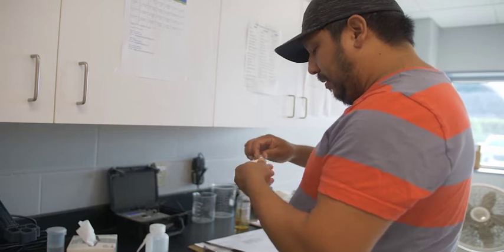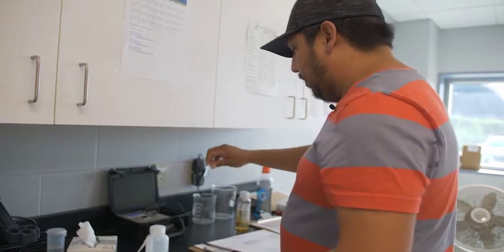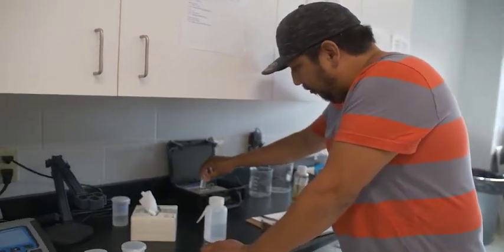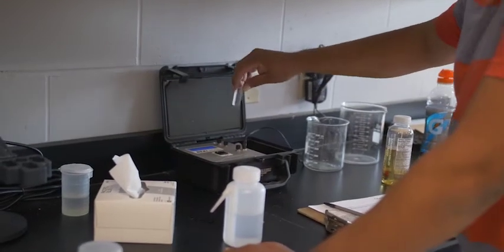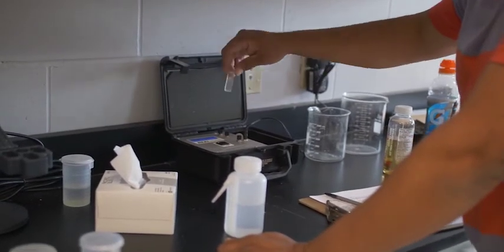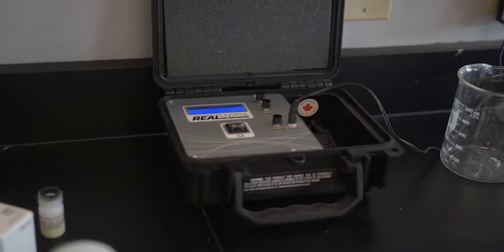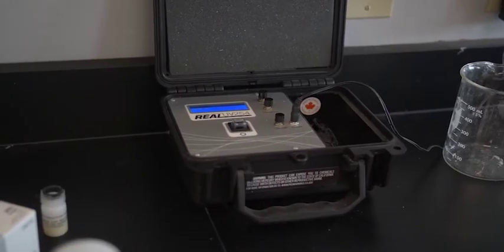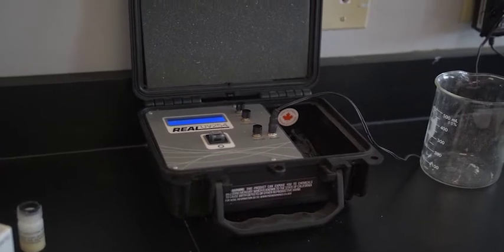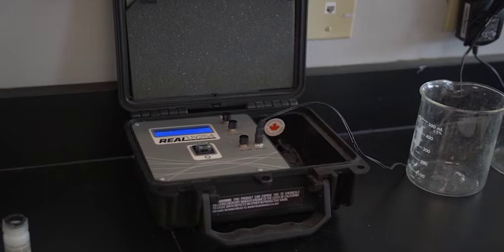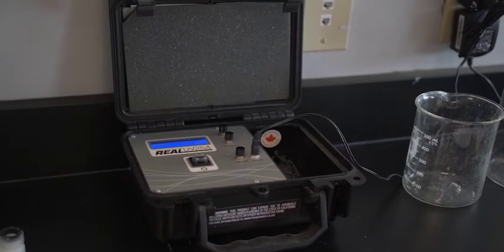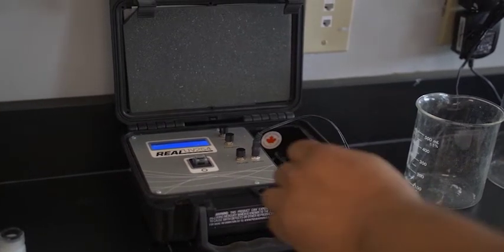So that's what this thing will do, it will do a manual test for us. I'm just calibrating the unit right now. This is actually distilled water, gives us a hundred percent UVT meaning that there's no blockages. The ultraviolet light will get to each and every organism regardless because there's nothing blocking the light to shine on the organism itself. So that's the calibration.